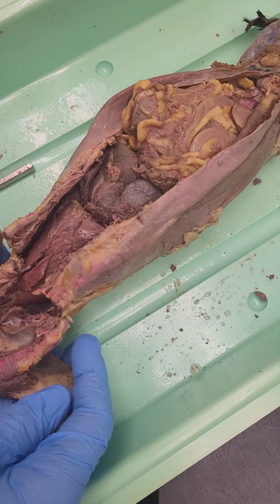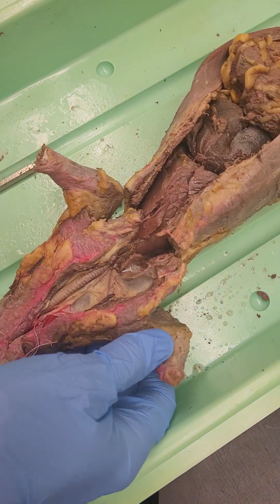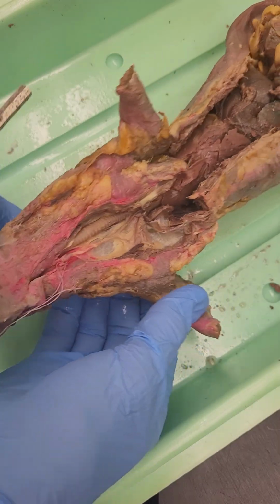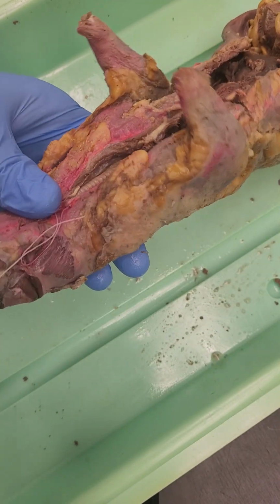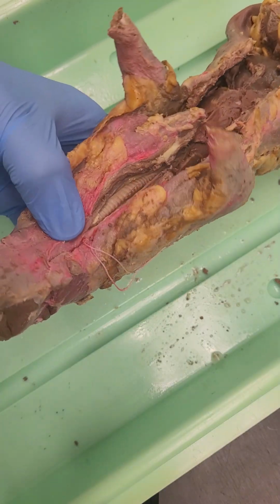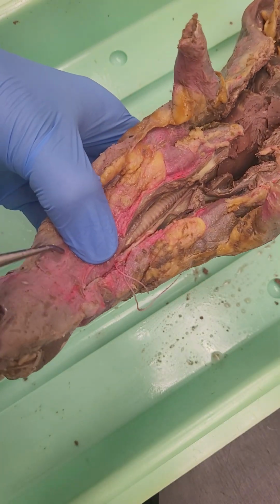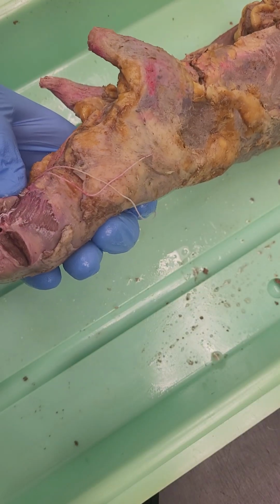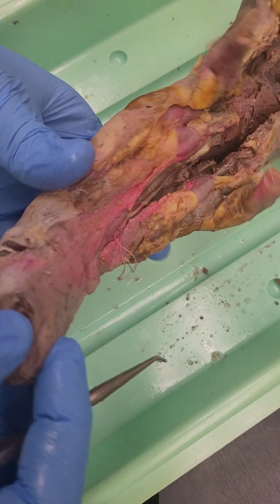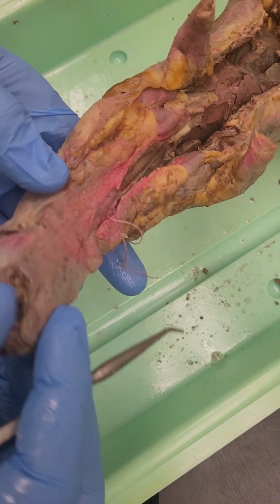Okay, this is a dissection of a mink. We can start at the anterior end. So if we look at this mink here, we can see in this region up front here, this has the mandibular glands, which are just located here, and to some extent here. The parotid gland is not visible. I think it's been removed with the skin in this mink.